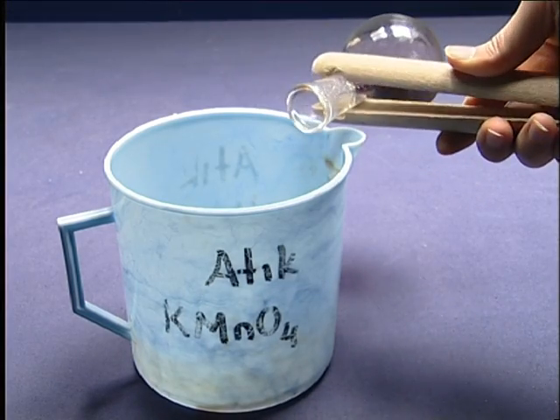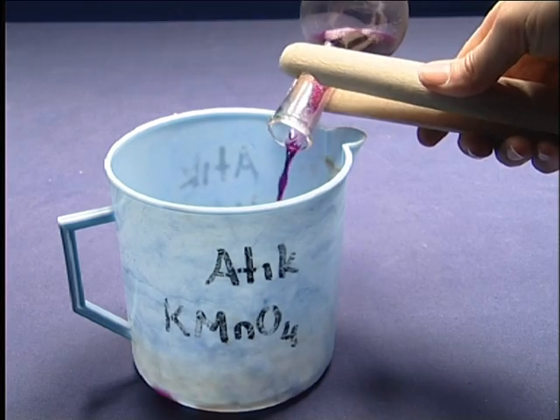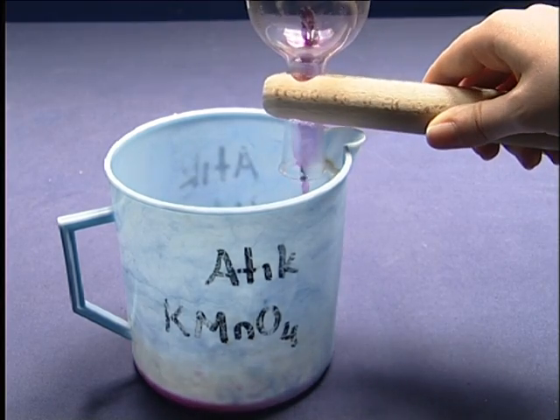Pour the remaining potassium permanganate solution into the waste. Do not pour it into the sink.